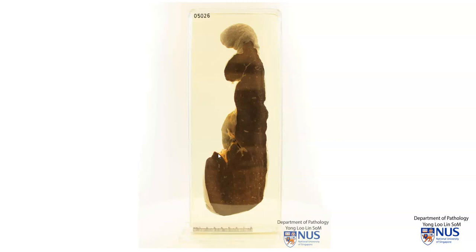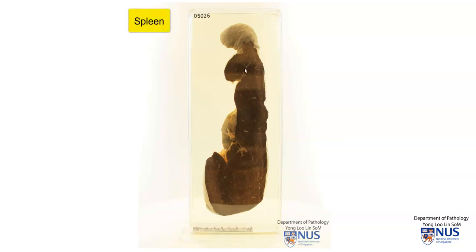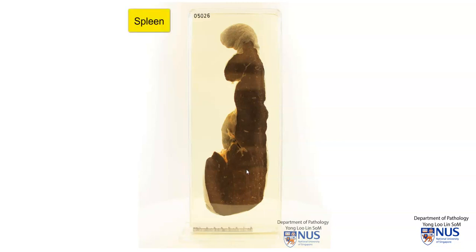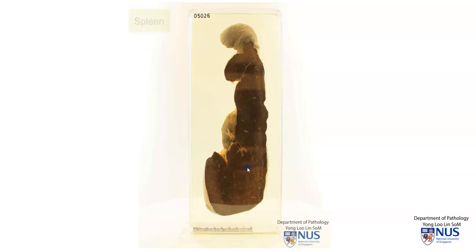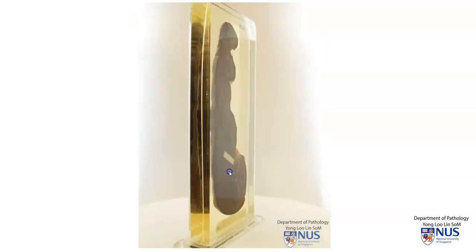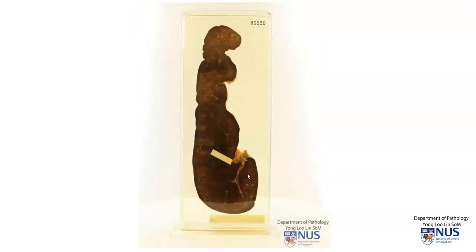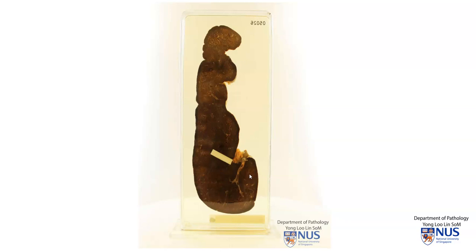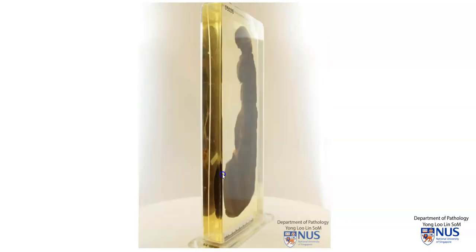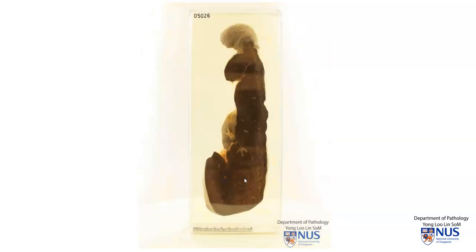Hello, this is a gross pathology specimen showing the spleen and we're looking at the cut surface. When I turn the specimen around, we can see that there is no definite discrete or localized pathology.